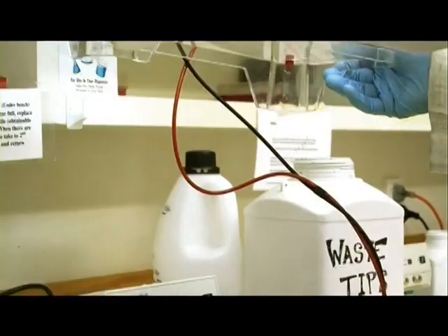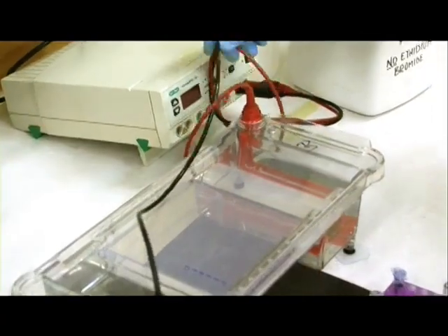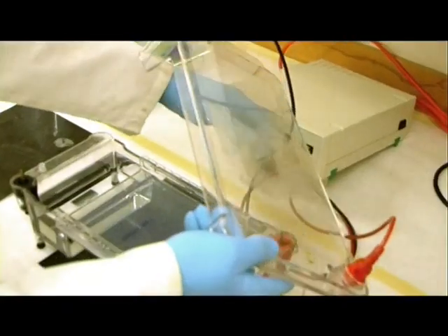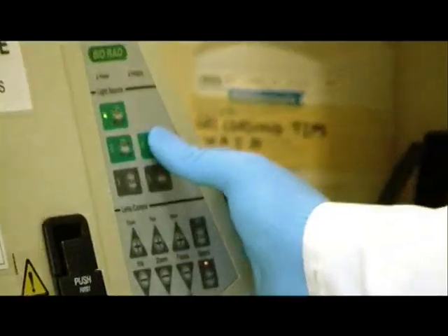We now connect the buffer tank to the power supply and allow current to run through the system. A DNA molecule carries a net negative electric charge because of the sugar phosphate backbone, and this means that it will migrate towards the positive electrode, and the loading dye will behave in the same way. Size separation is achieved through interaction with the DNA and pores in the gel matrix, where small DNA fragments pass easily through these pores, and bigger DNA fragments are slowed down. Therefore, small DNA fragments will have moved further than big DNA fragments. In order to see the DNA in the gel, it is placed on a transilluminator, which shines UV light up through the gel, and the camera captures the picture above it, which can then be saved or printed.